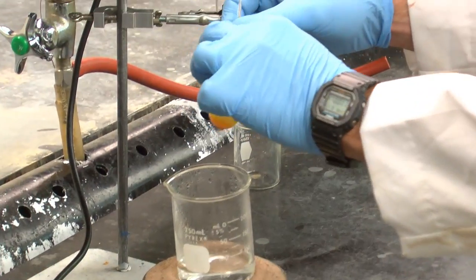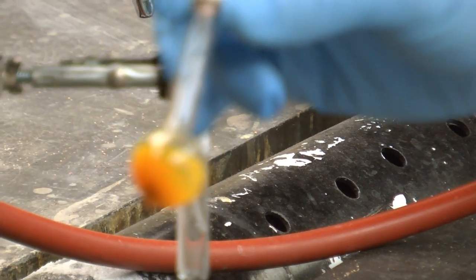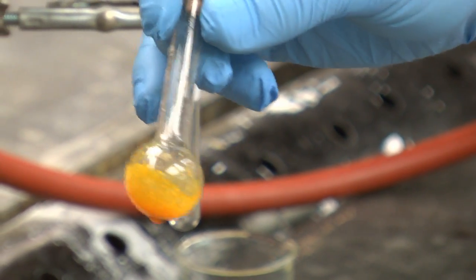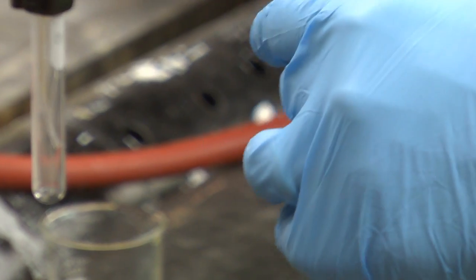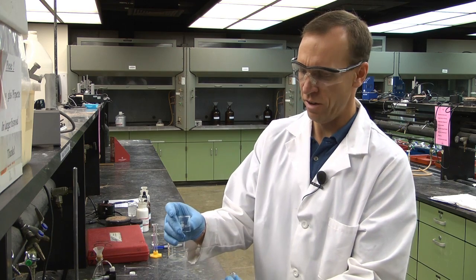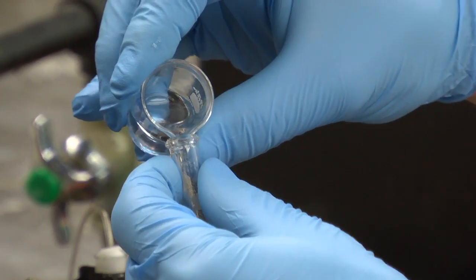Okay, so it's been 20 minutes of reaction time. This is what the reaction looks like after the 20 minutes. It's slightly an orangish brown color, and it's very thick and crusty. So in quenching the reaction, I'm just going to add the HCl solution that we talked about before. This is 4 milliliters of the 3 molar HCl, and I'm just going to put it in here.